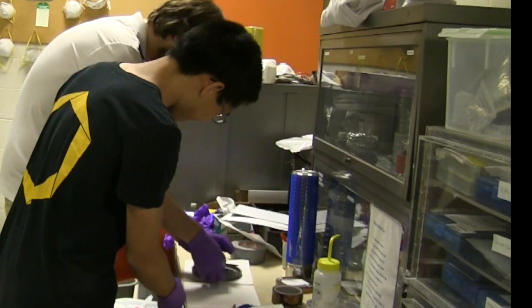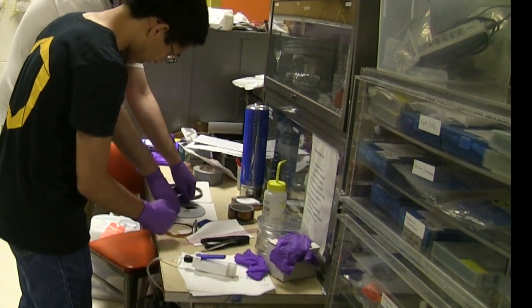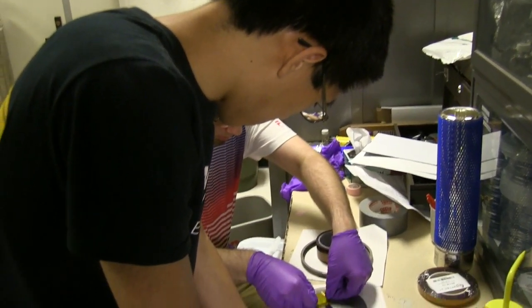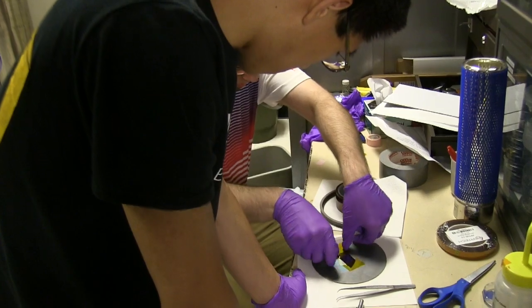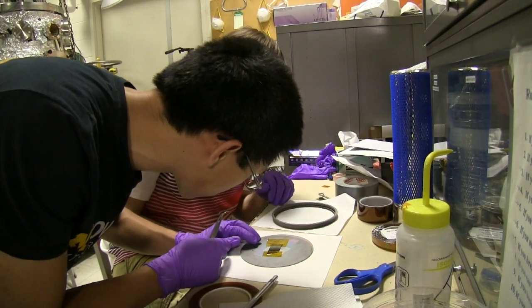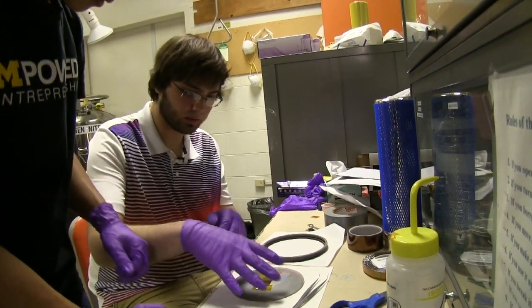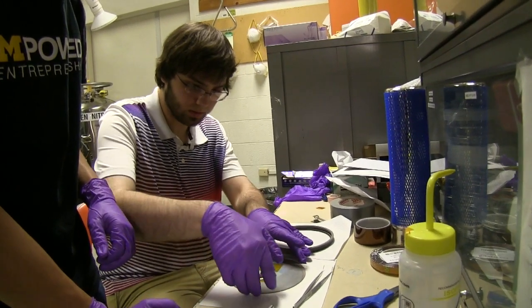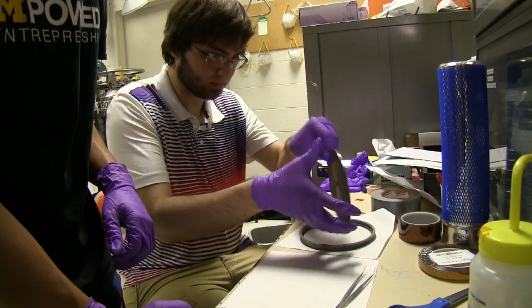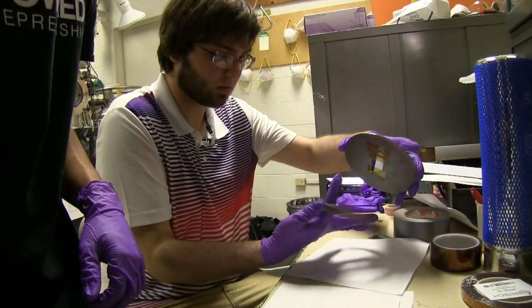We use a special tool called a profilometer that lets us measure the thickness of the sample. An easy way to use it is to apply tape beforehand so that there is a very clear, distinct ledge between where the sample is and where it ends. We are adjusting the tape a little bit so that we can get a more distinct edge for that profilometer measurement. The tape is also securing the sample to our sample holder plate, while simultaneously creating an edge where we have germanium and then suddenly no germanium.